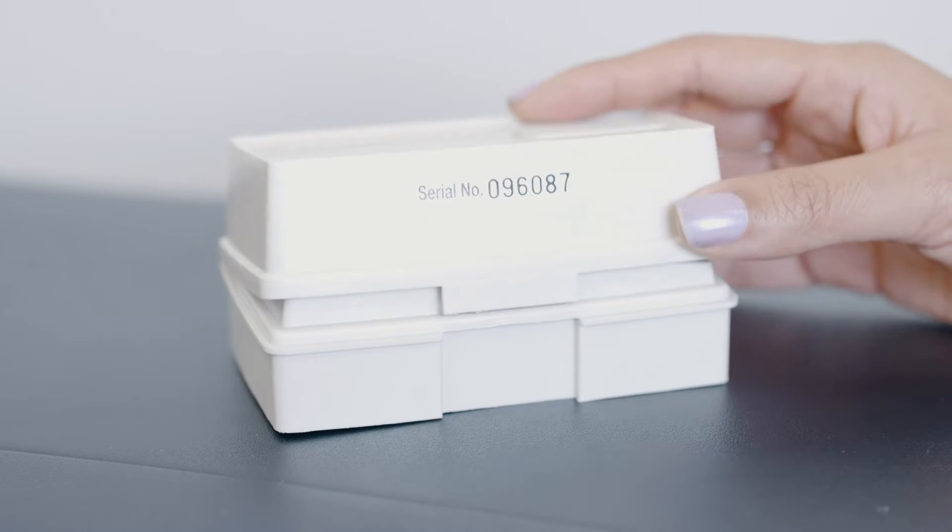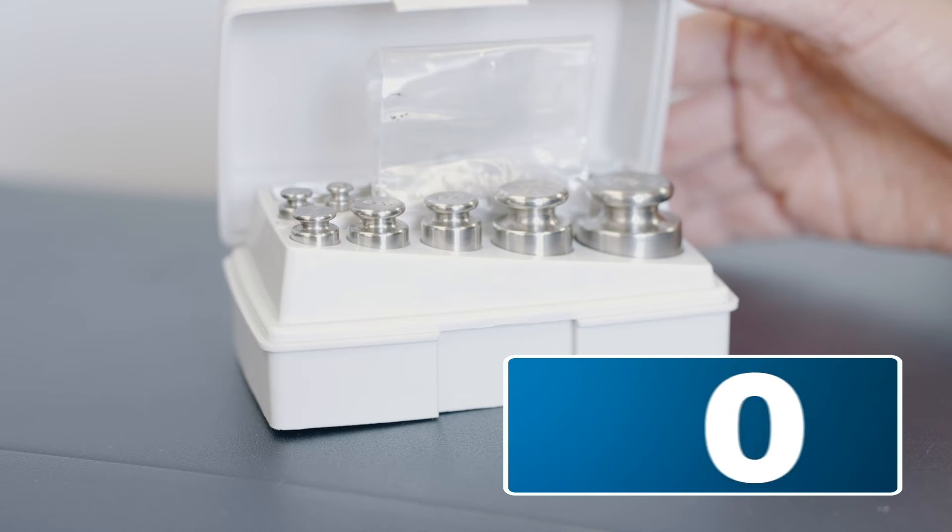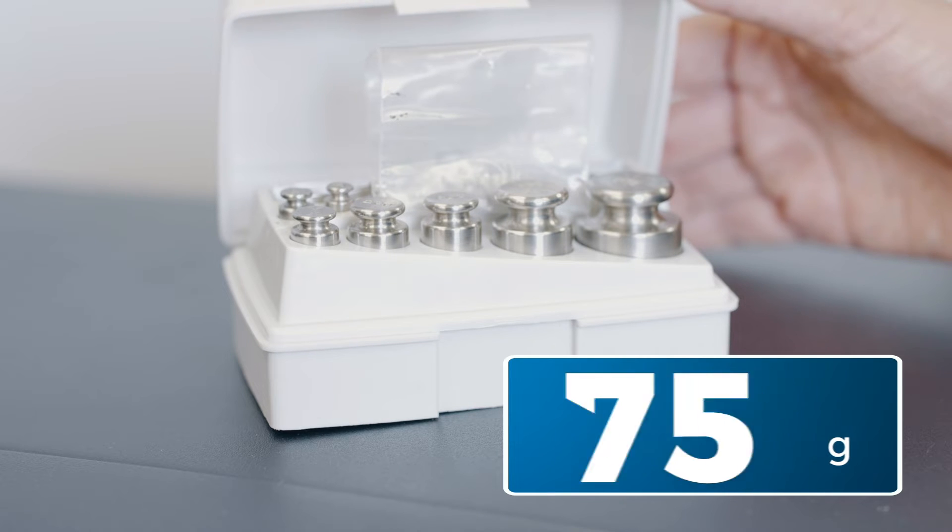For both options three weights are recommended: 0, 50 and 100 grams.